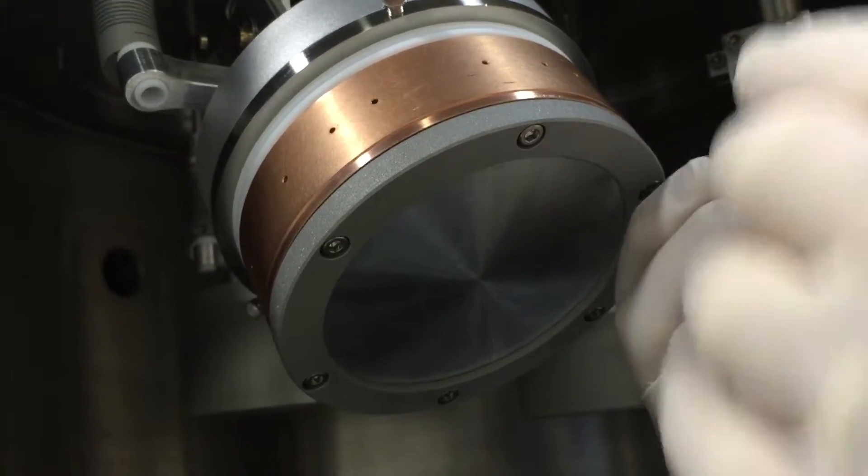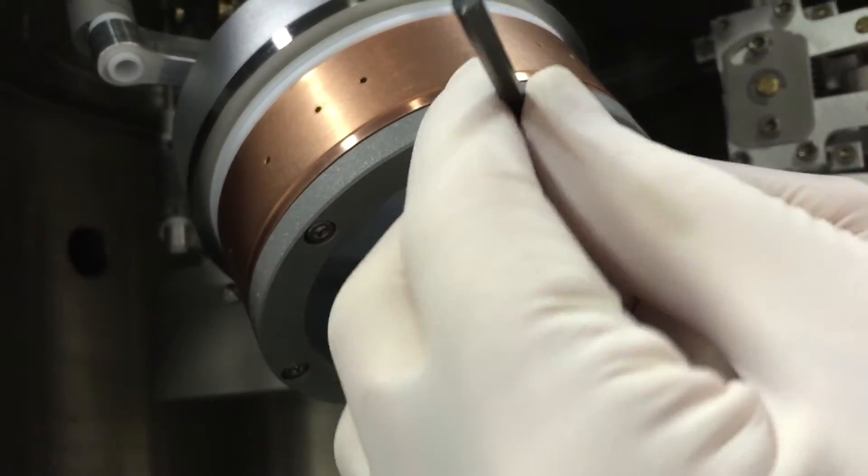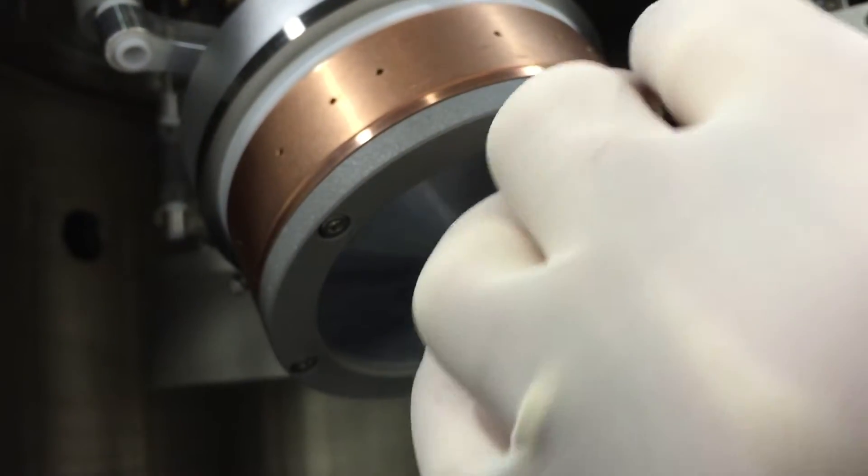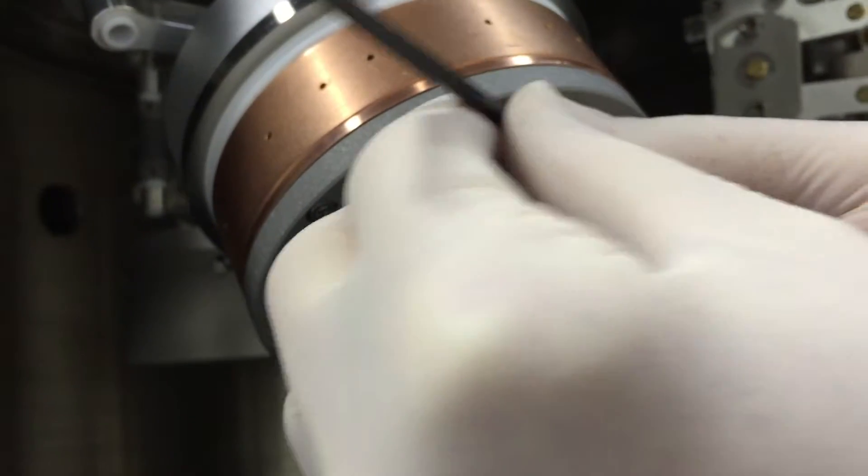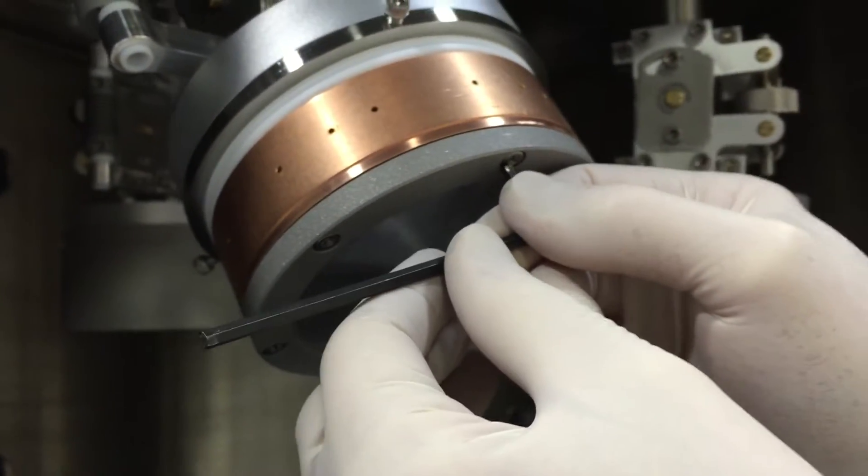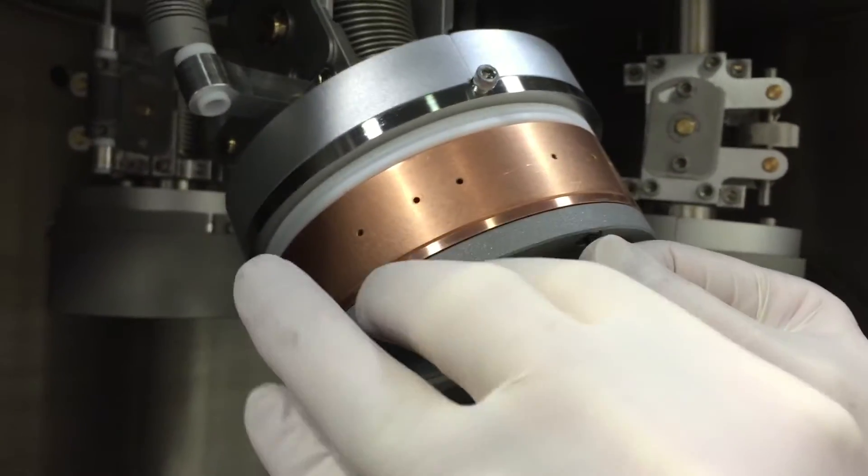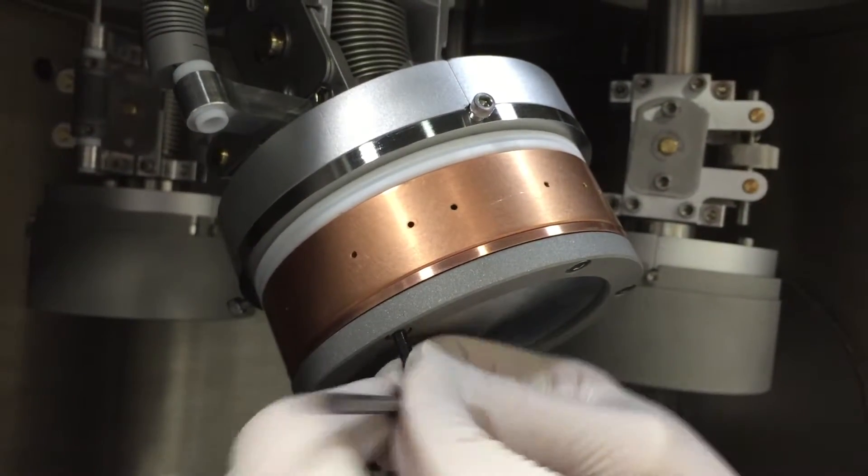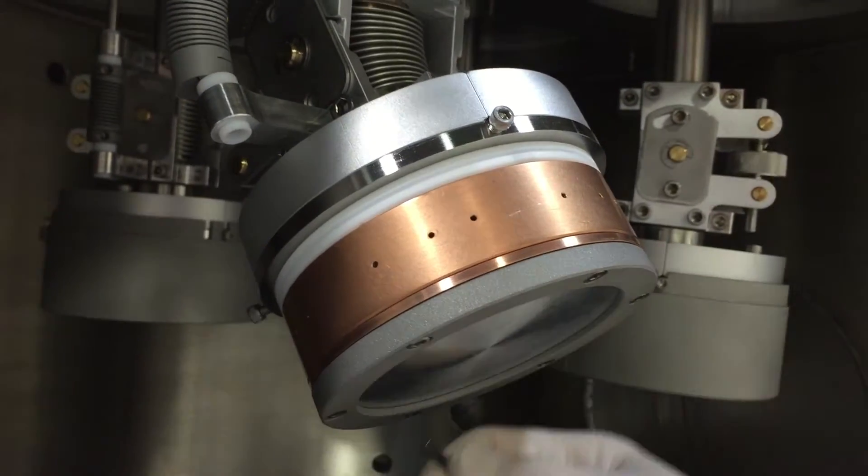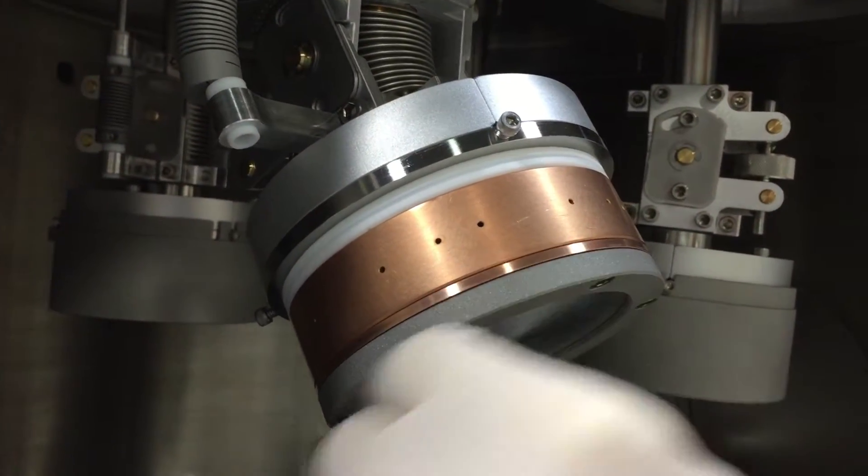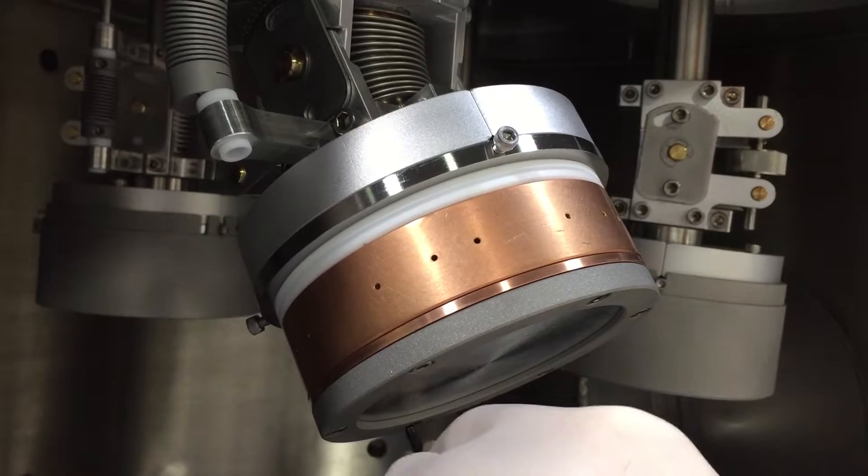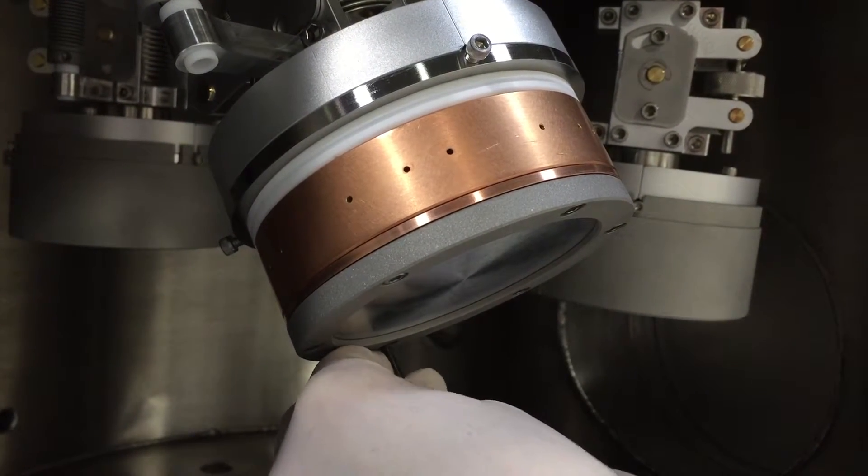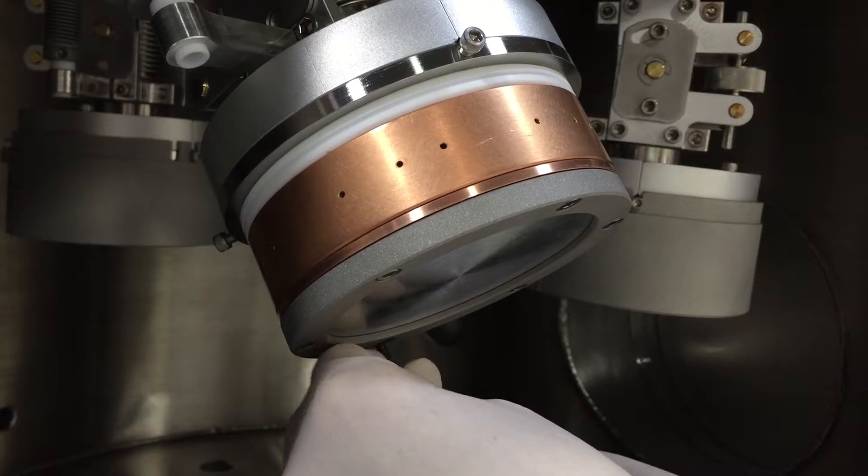First we loosen these just a little bit. Easy for me to say. And then we can remove the outer target retainer.